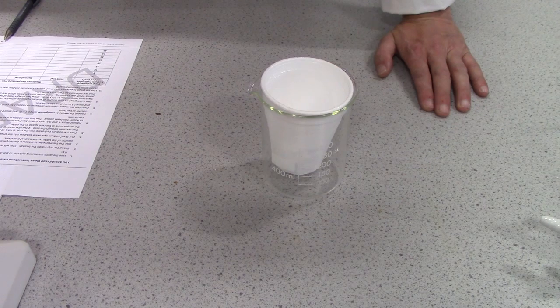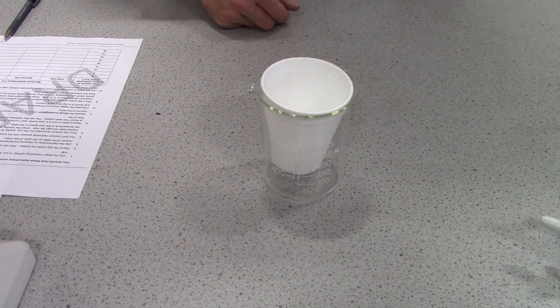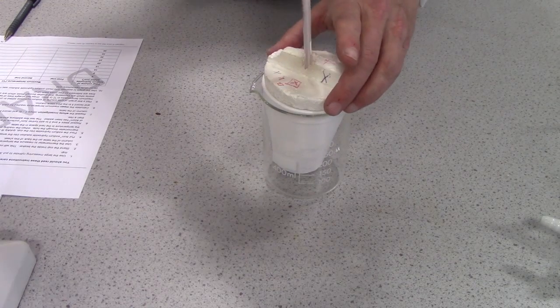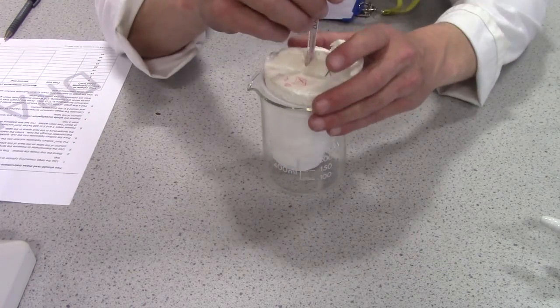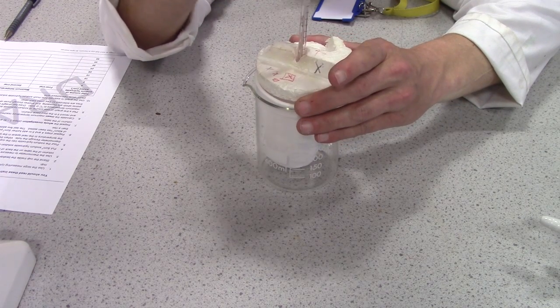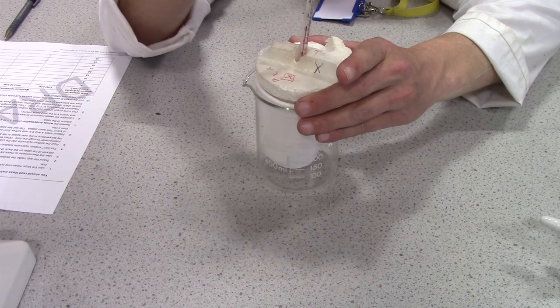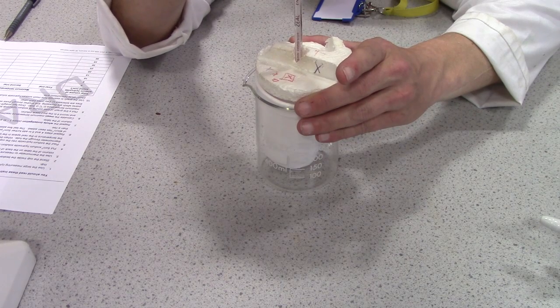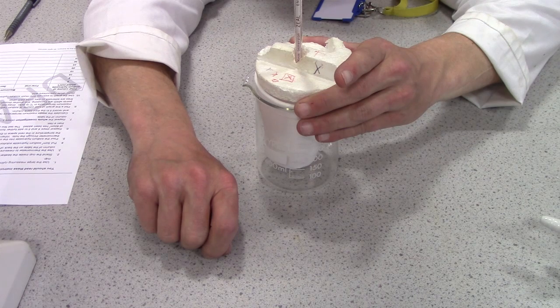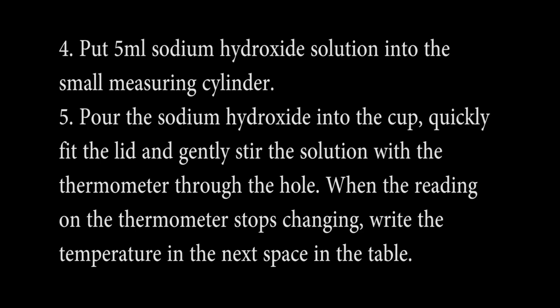Use the thermometer to measure the temperature of the acid and record it in the first blank column of the table on the back of this sheet. The downside of using long ones is they are a little bit tippy. Give it a little stir so we know — have a look, is the temperature changing? No. 22 degrees.